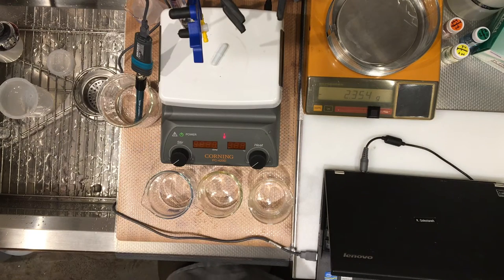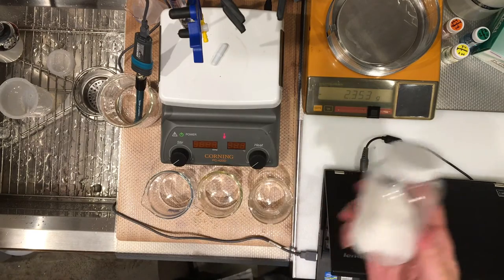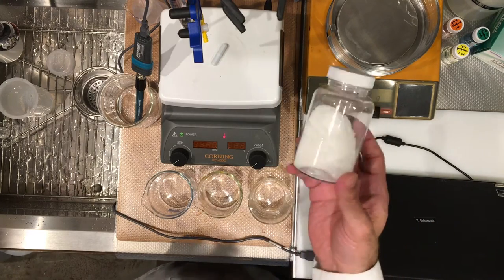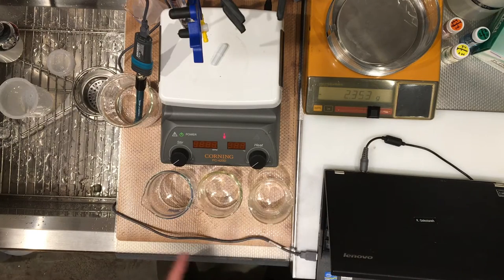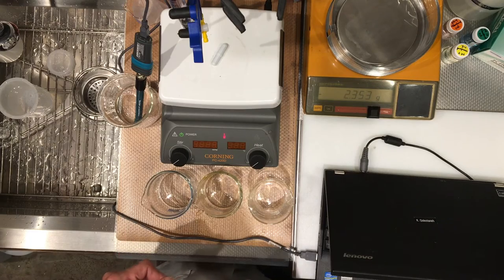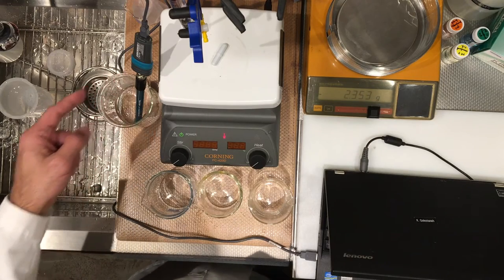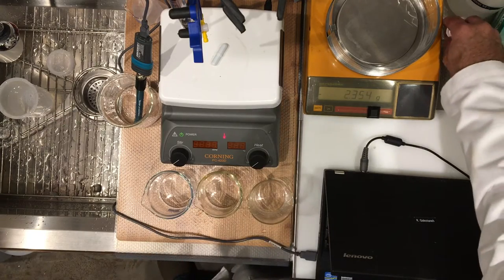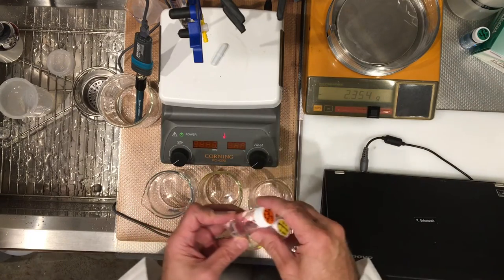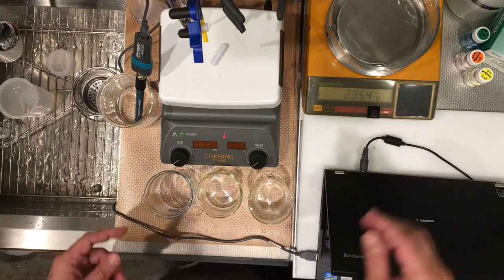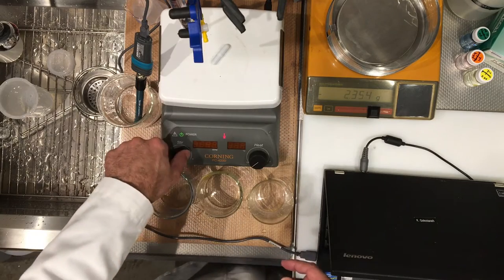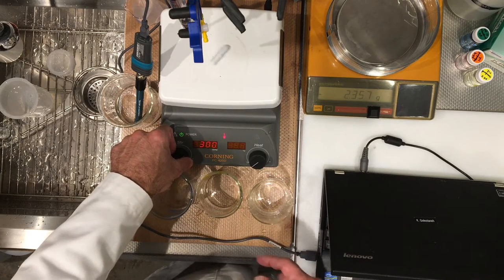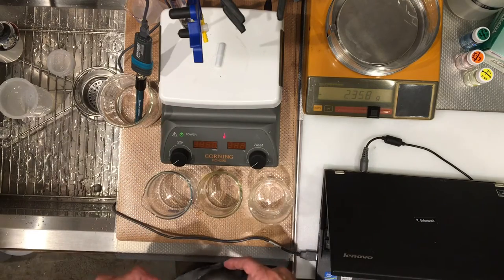And the unknown acid is right here. It's a solid acid, and it's very fine powder. So we're going to weigh this acid into three beakers that are going to be set up for pH titration, and I have a pH probe that's calibrated for pH buffers four and seven earlier. I did that and I just checked the calibration, it's still holding well. And we're going to be putting the probe into these beakers, I have a magnetic stirrer that will work to mix my solution. So I'm going to put that in my beaker to dissolve the solids as well.